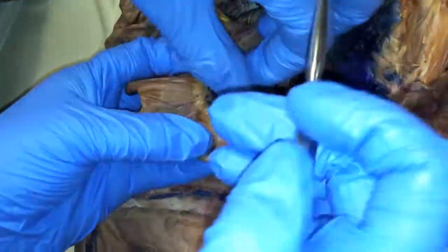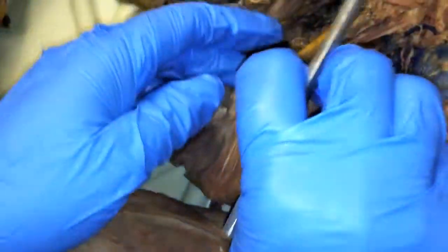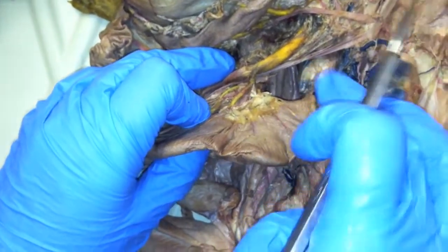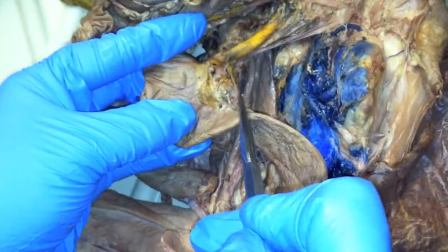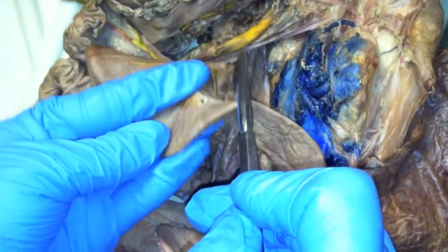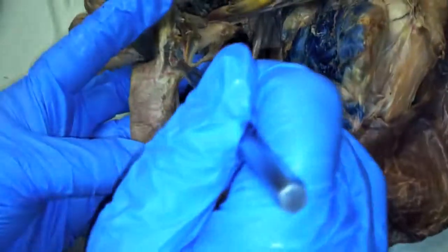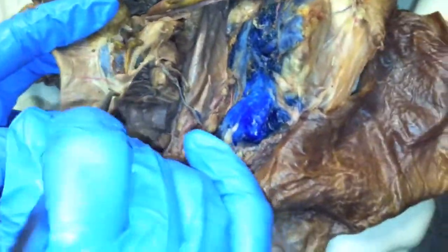This tore off here, and that one goes up there. So where it attaches here, this would be your caudal mesenteric. And this would be your middle colic. And then the other part of that coming up this way is your left. So it goes middle and left together to form your caudal mesenteric. So your left is running all up here this way.